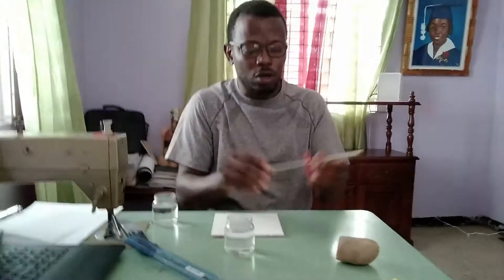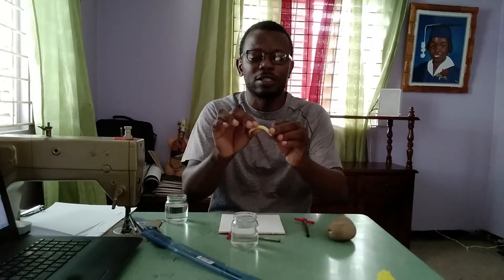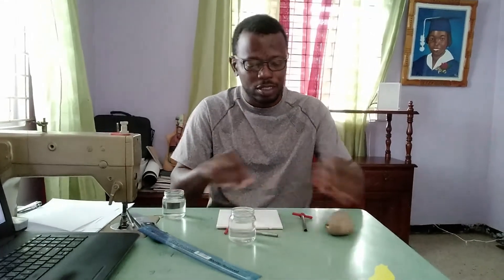We are finished with the measuring cylinder for now. We're going to need a ruler and remember we are measuring in centimeters. To use the cork borer, all we do is shove it into the potato and pull it out, and we'll use this to get two pieces. We shove the corer in and pull the core out. It's like a worm — it's pretty flexible. We're going to get another piece the same way.